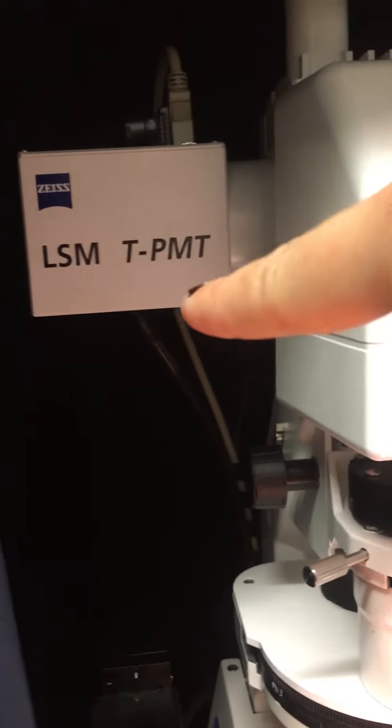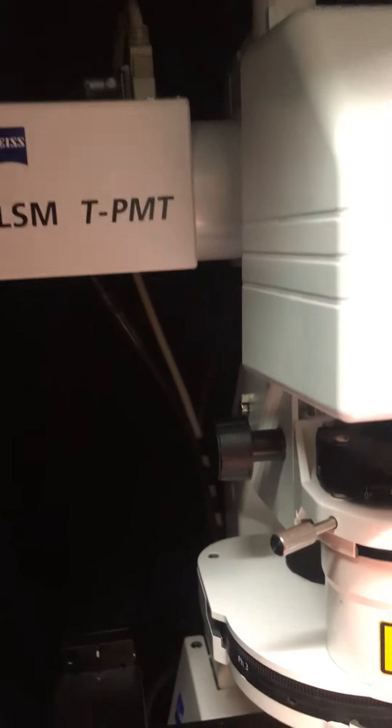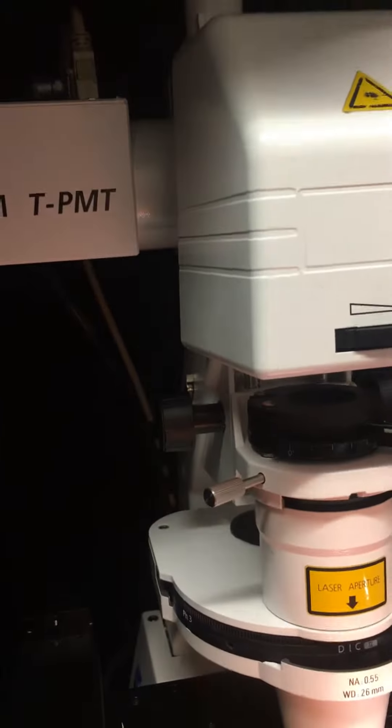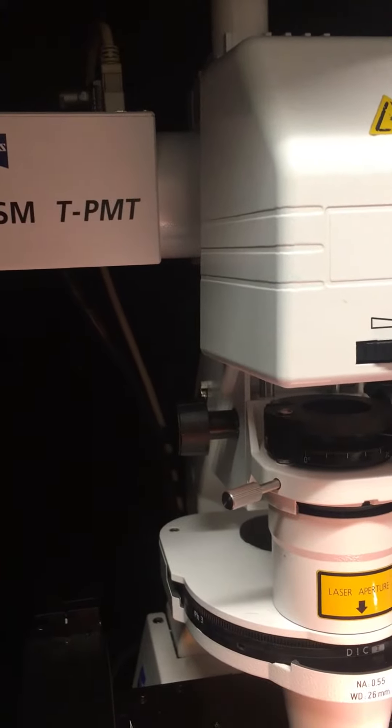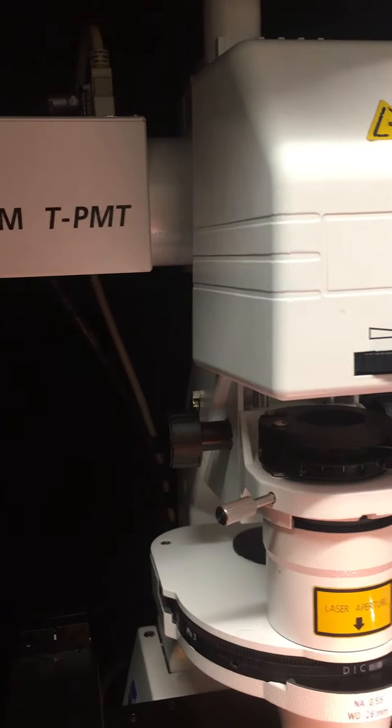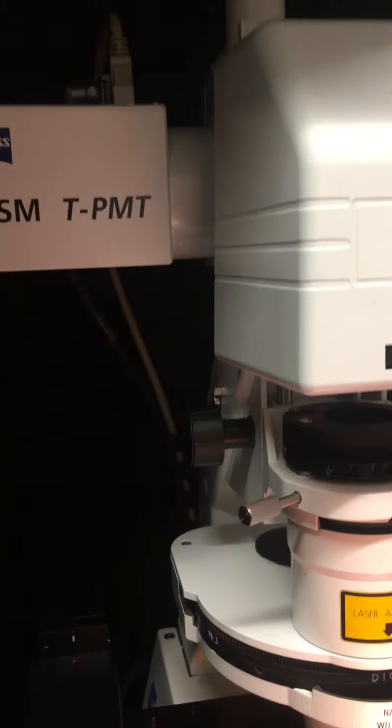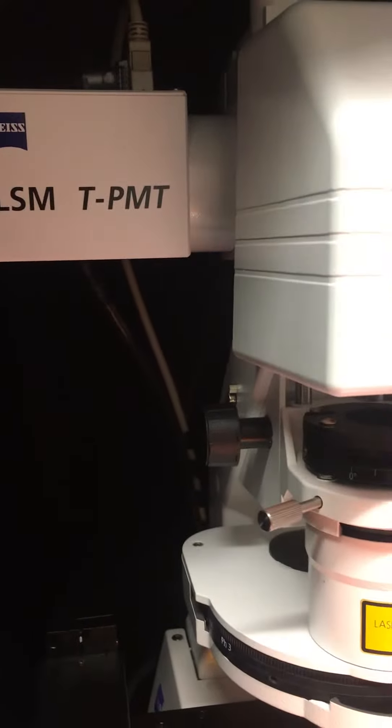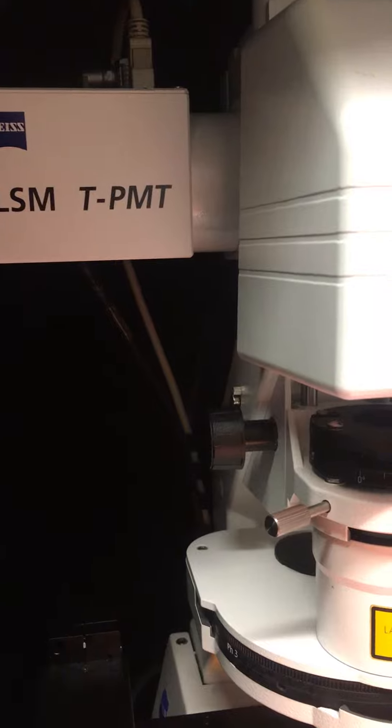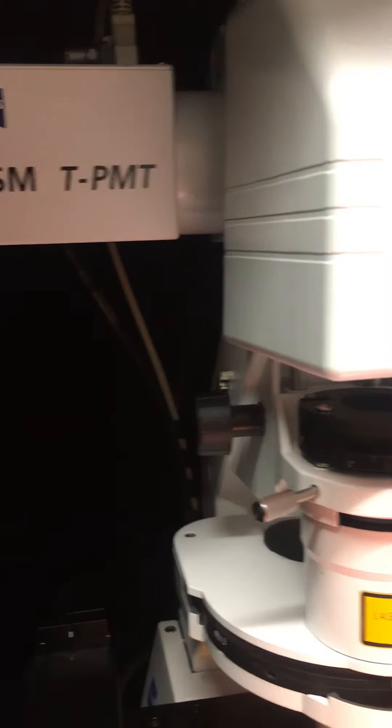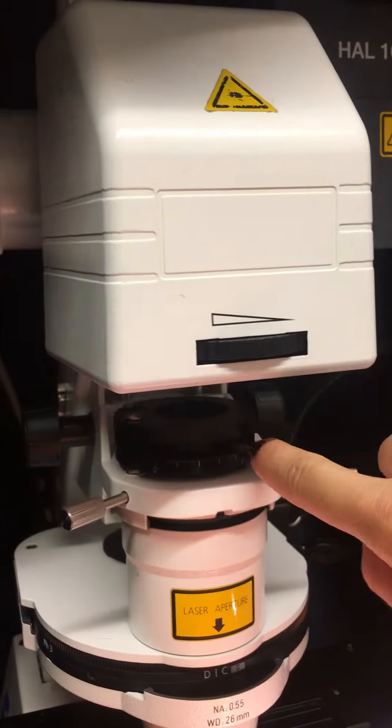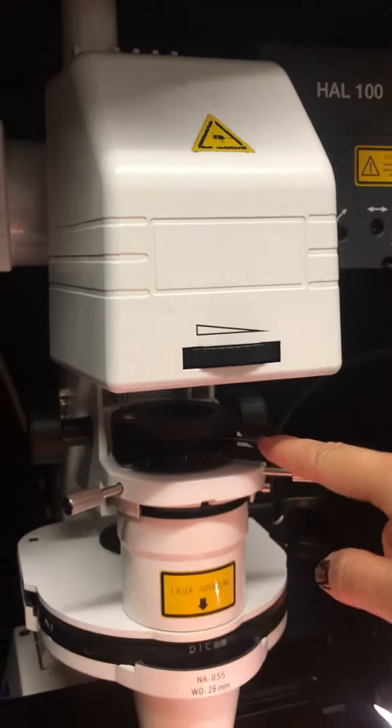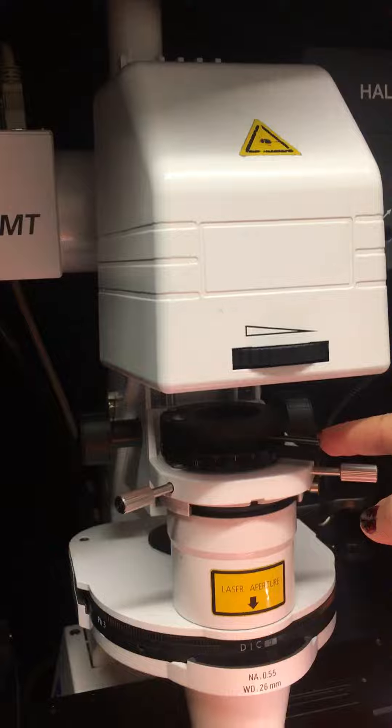Please know that this little component will be later on in the way of the laser going through your sample towards TPMT, and our lasers are polarized. So in case if you don't see any light at all in your transmitted light channel, please check if the position of the polarizer changes the situation.